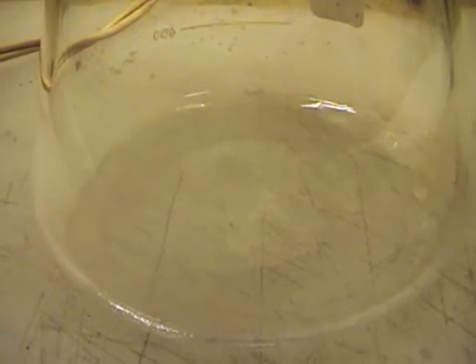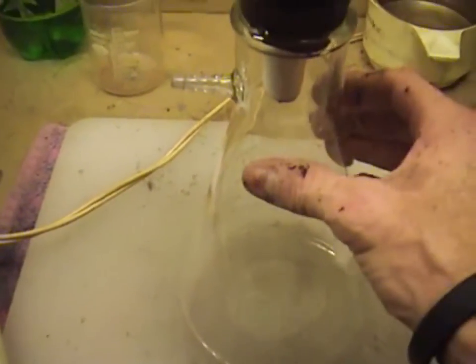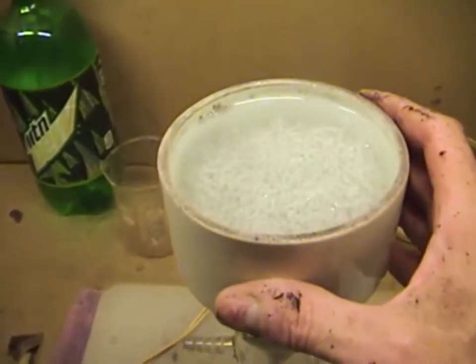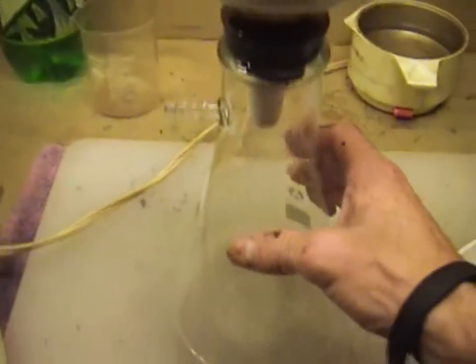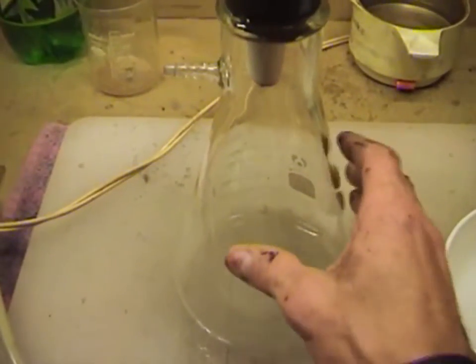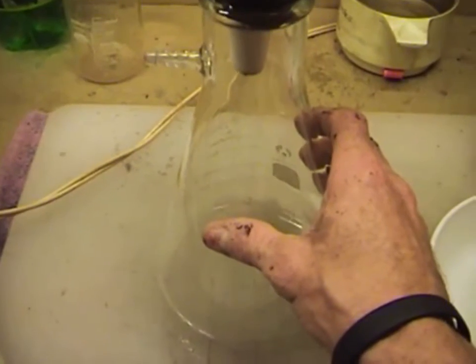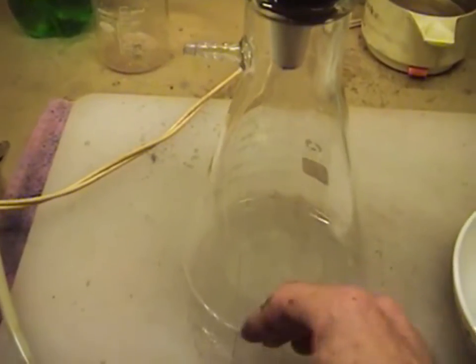It's just slowly draining through the bottom of the funnel. Notice that the solution coming out is clear, which tells us we've done a good job. Now you'll want to take this rinse water — there's still some residual silver nitrate, meaning there's some silver still trapped. You want to take this and add it to the cell solution we just put in our stainless pot so you can put a piece of copper in there and recover anything that may be left.